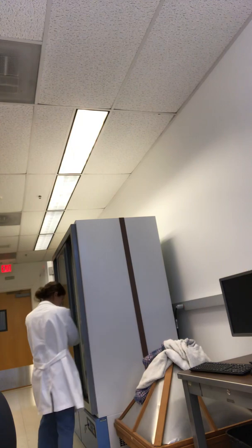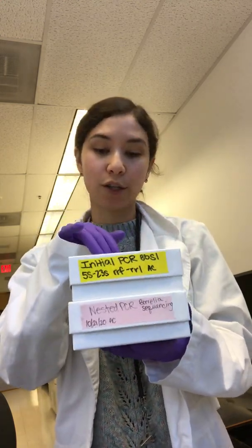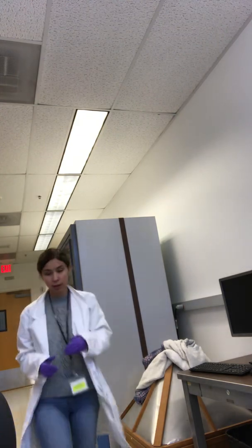So let's get our first box. There are 2 different boxes for your initial and your nested PCR. Both of these have separate reagents, so if something gets contaminated, it's easier for you to keep track. The correct primers should be in each box too, so you should have your initial primers in your initial box. I still like to check what's written on the tube, because sometimes people get confused and things get moved around, so just always double check things. Let's keep our initial box out for now. Okay, so in our initial box, we have everything we need.